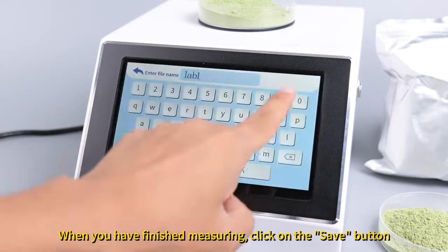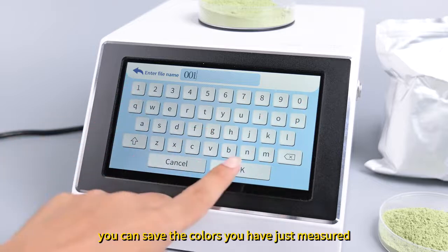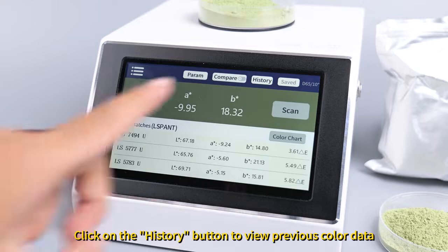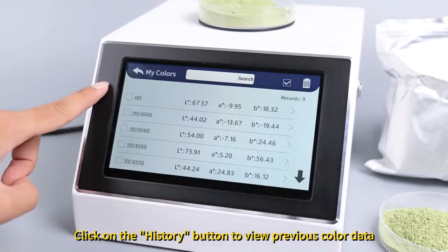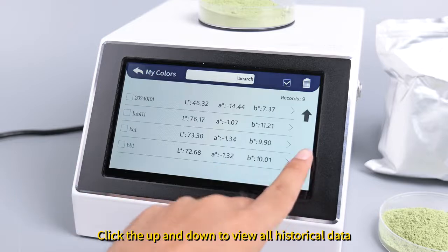When you have finished measuring, click on the Save button. Enter the name here. You can save the colors you have just measured. Click on the History button to view previous color data. Click the up and down to view all historical data.